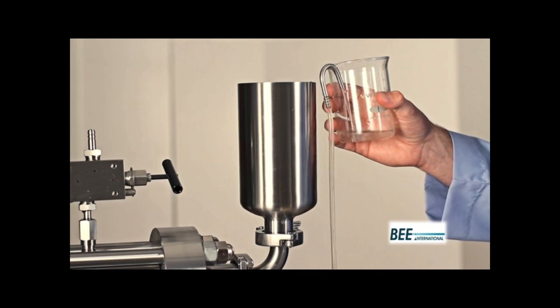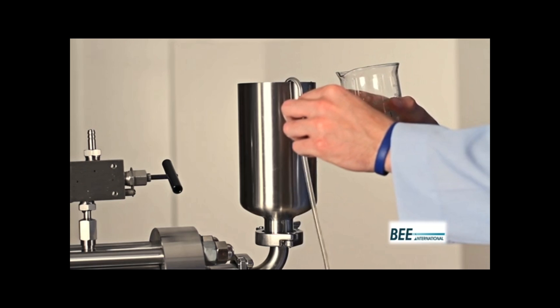Your product is now being processed. You may collect or recirculate your product.